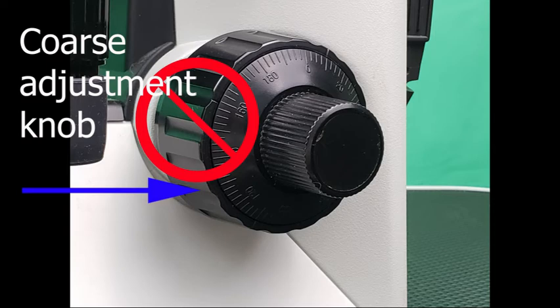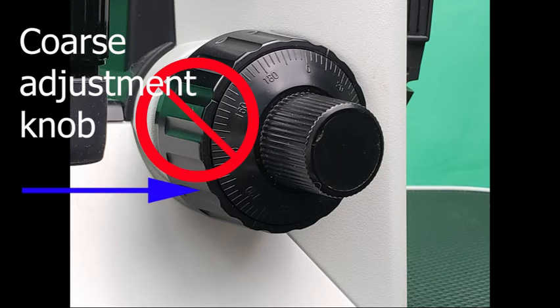If you are unable to focus with the fine adjustment knob, go back to the previous step and try again.